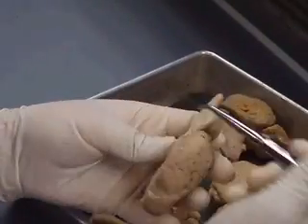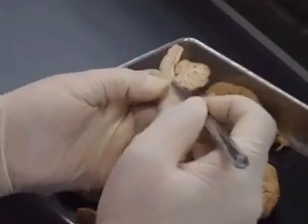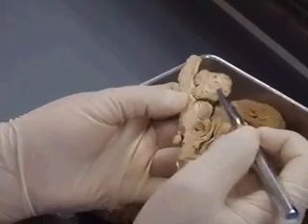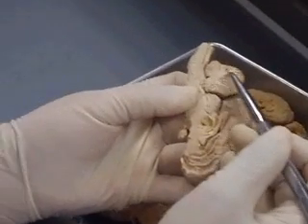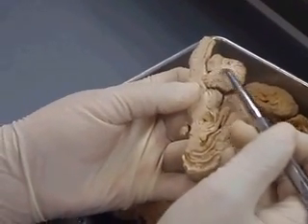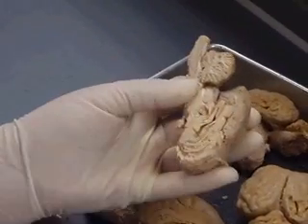You guys should all know this — and what is this called? The arborvitae. The inside part is white matter, and the outside is then the gray matter.